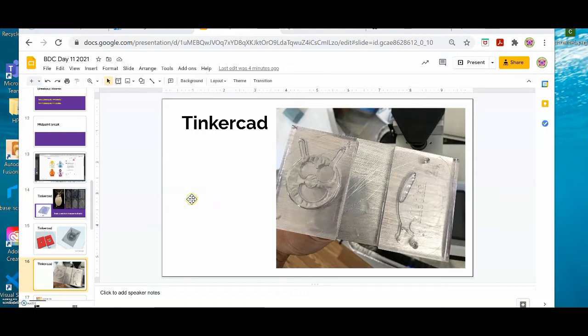Hi Biodesign Challenge teens. This is a workshop that's going to review how to make clear root study tools using Tinkercad and SLA printing. And here's some examples from a couple of your cohorts. The one on the left is by Alec and the one on the right is by Isabella.